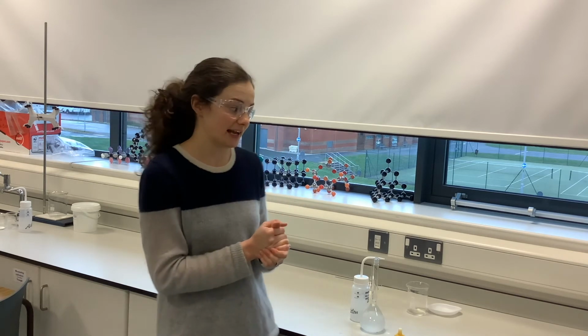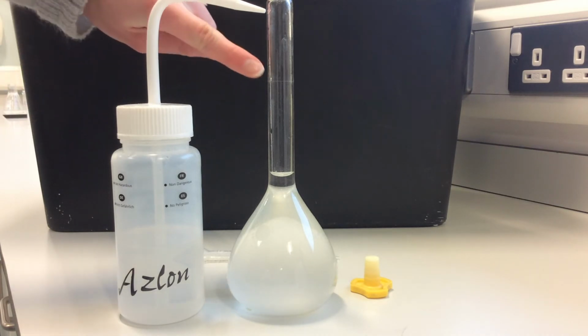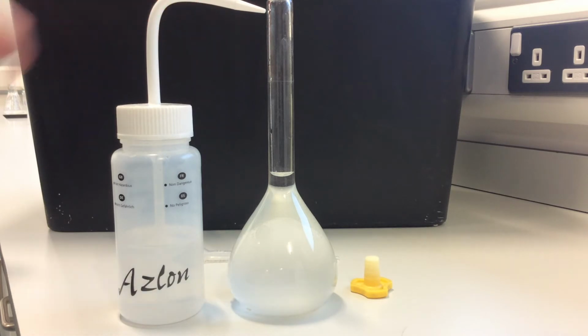So what I'm going to do is zoom in and show you that, so you can maybe see the mark a little bit better, and we can see it getting up to that level. What I have here is my volumetric flask, which is nearly filled with water up to the mark, but I just wanted to zoom in and show you that making up to the mark. It maybe seems a little bit random, but I have put the recycling bin behind it. It allows you to see that mark a little bit more clearly. So hopefully you can see just here we have our mark, and that allows us to see when the solution has been made up to 250 centimetres cubed. So I want to add water until it gets to that point, and then we will mix it.